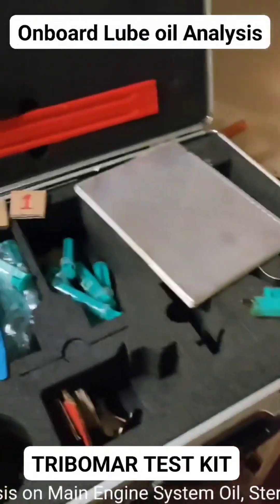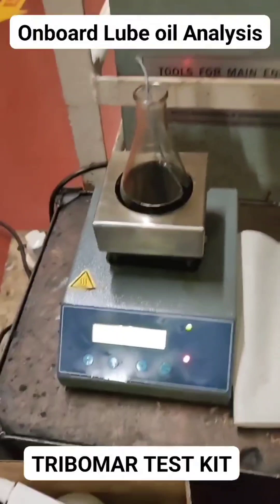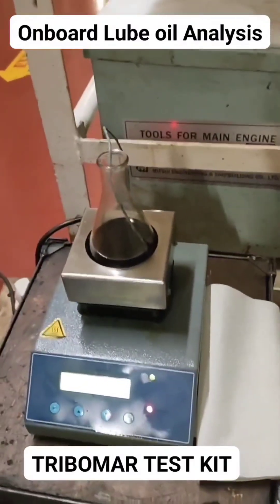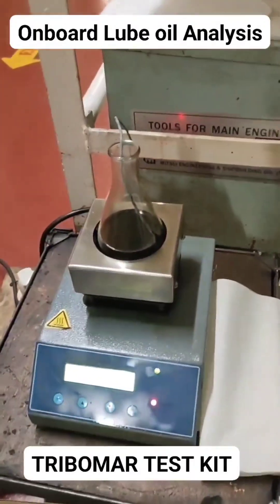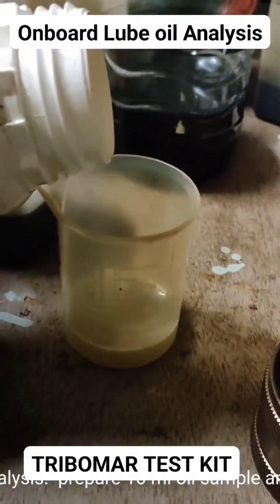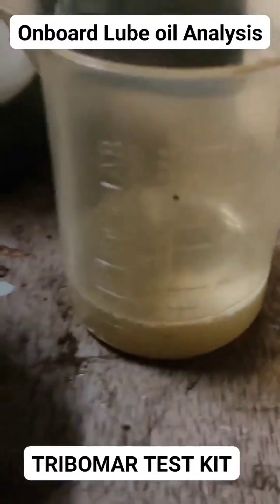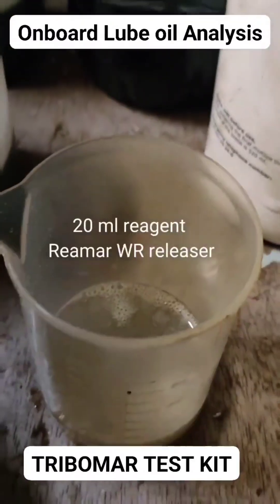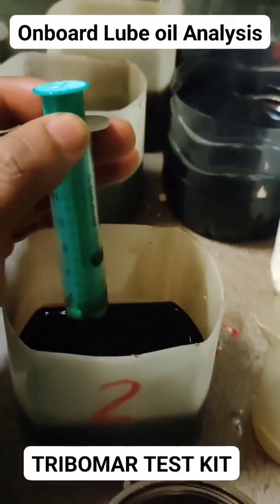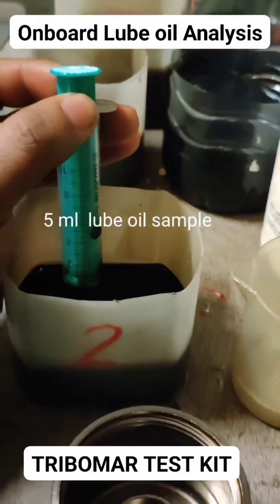Good day to all. Today we will conduct regular onboard lube oil analysis on main engine system oil, stern tube, generator engine system oil, water and oil analysis. Prepare 10 milliliters oil sample and 20 milliliters reagent. Also prepare 5 milliliters lube oil sample with the releaser.